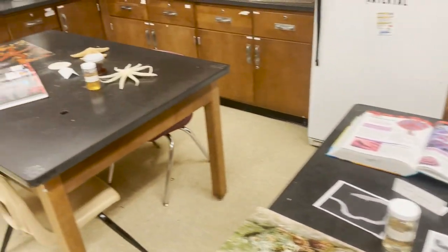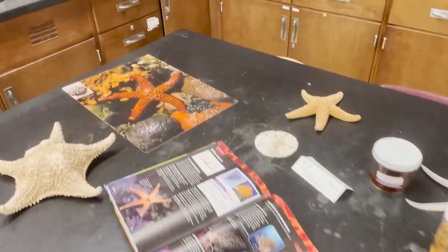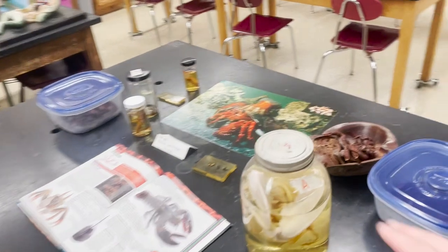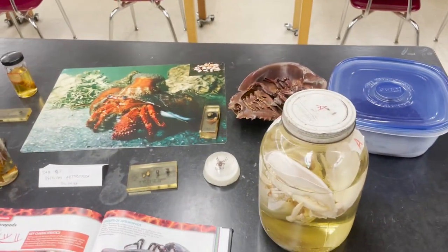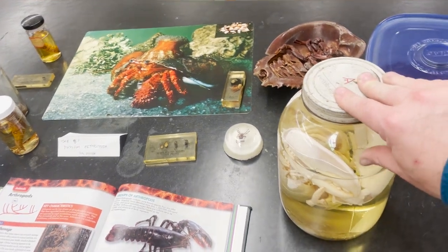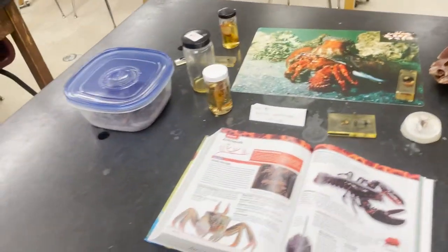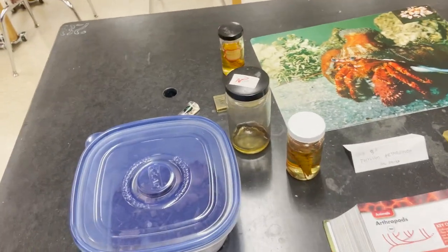You're just going to bask in their diversity. We've got some echinoderms over here, over here we have some mollusks, etc. Any that are in these old jars that look ancient — absolutely do not open them. There are poisons in there, some of them are irreplaceable specimens, and most of them are in stuff we're not allowed to use anymore. So no opening them.